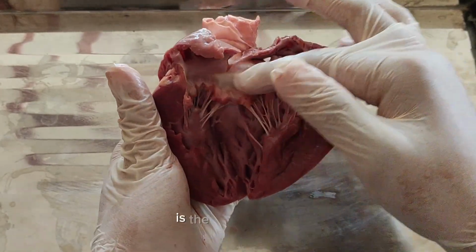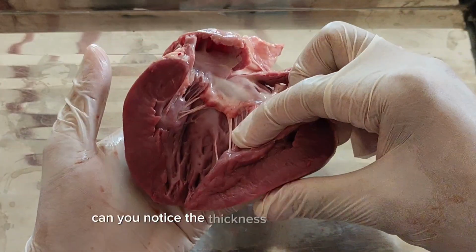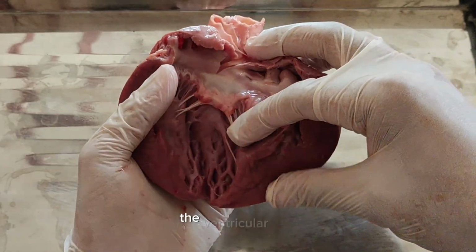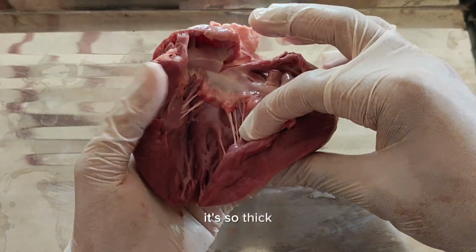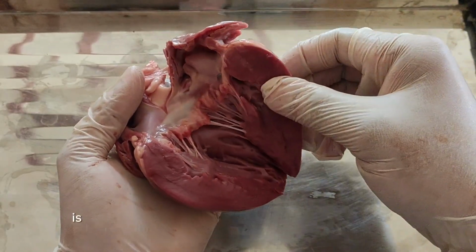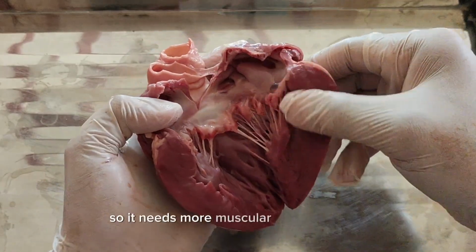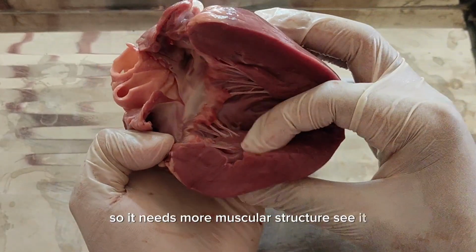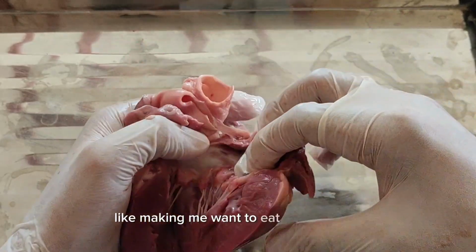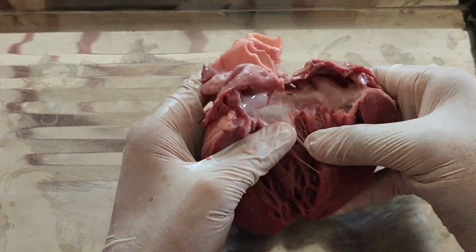And everyone, can you notice the thickness of the muscle here of the left ventricle? The ventricular wall, it's so thick, because this heart chamber is responsible for pumping blood throughout the body, so it needs more muscular structure. See it? It's very thick. Like making me want to eat it. Like a meat. Fatless meat.